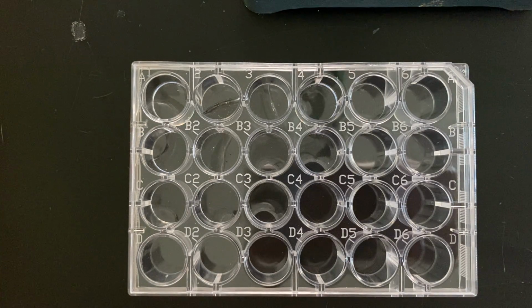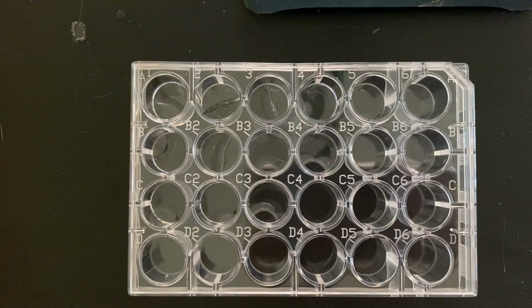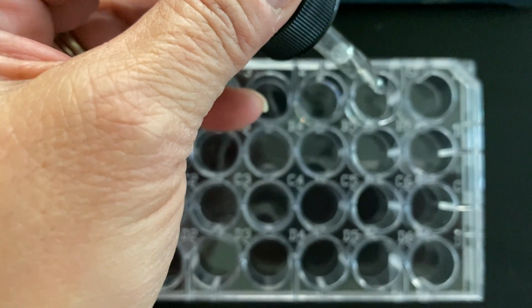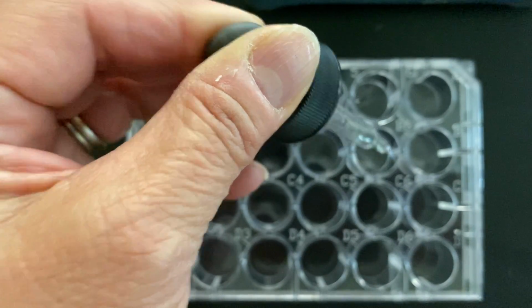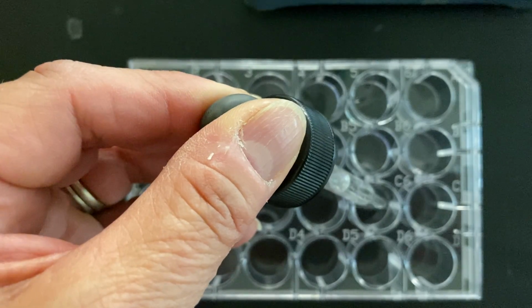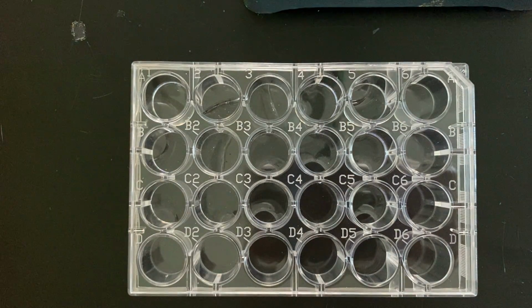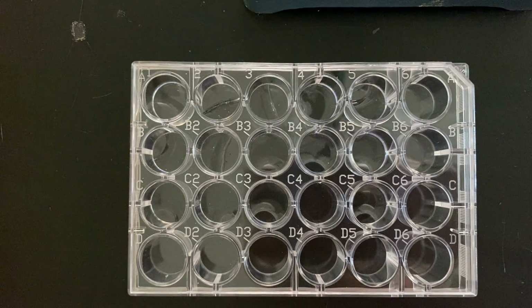And then you're also supposed to do an unknown. So for us, we are going to do unknown letter P. P for plata. How's that? So I'm going to put 3 drops in the 5th column. And what you're going to do is see if you can figure out which alkaline earth metal is making up this unknown substance P. All right, so make sure you write that down in your lab notebook, unknown P.